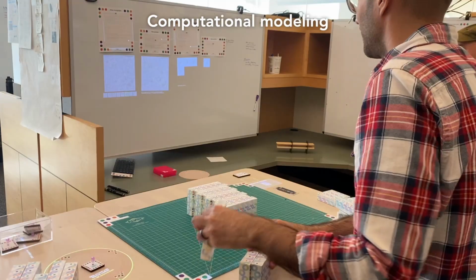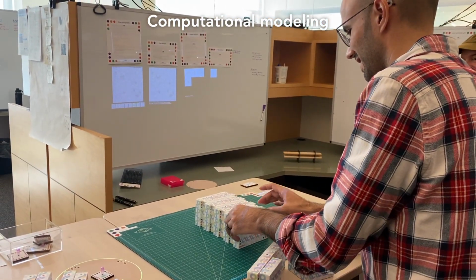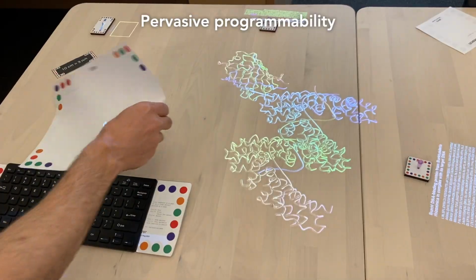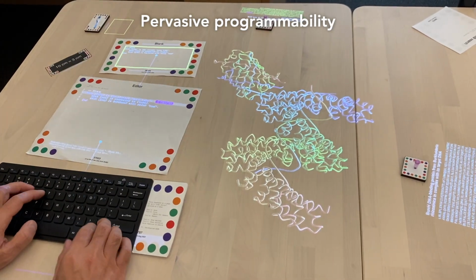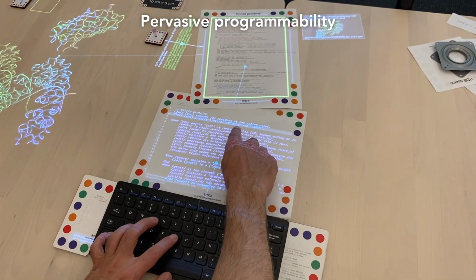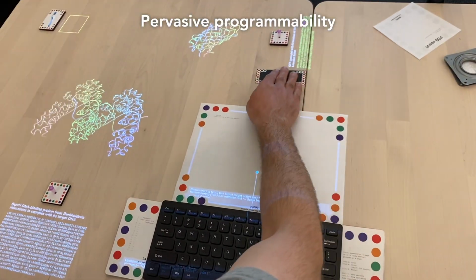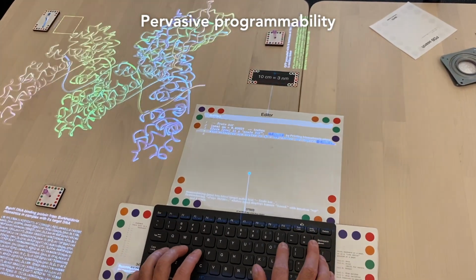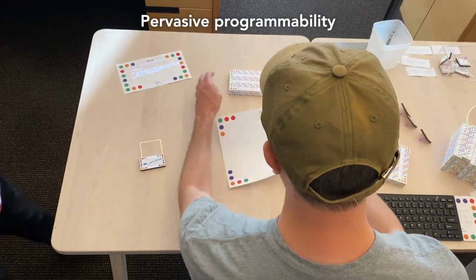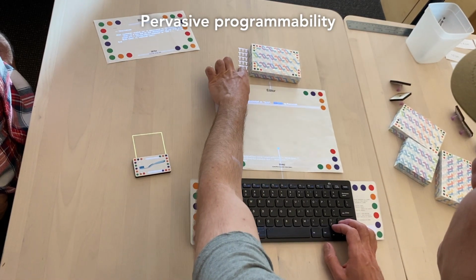And a computational model also serves as a precise representation of what we think we understand. So if we do a physical experiment and it doesn't match our simulation, then we've actually learned something and we can update our models. The last key concept is that this is a completely programmable environment where programs can be quickly improvised in the moment. Here we're adding a different linker to our protein splice by directly editing the splice program. Here I'm making a new scale bar by editing an existing one. And here we're directly programming an origami block to simulate passivation.